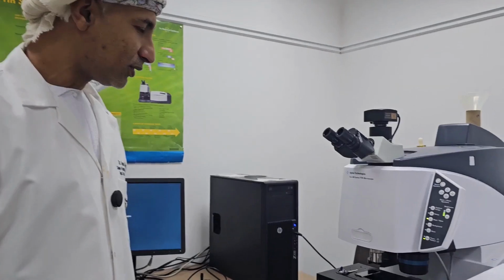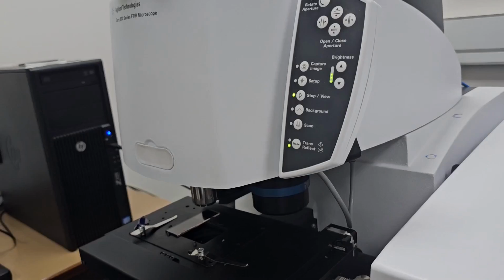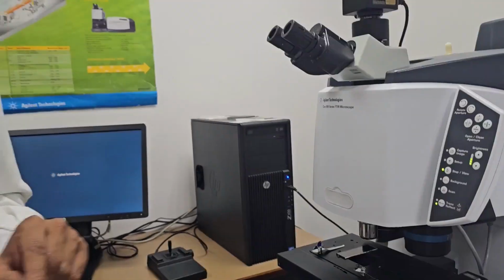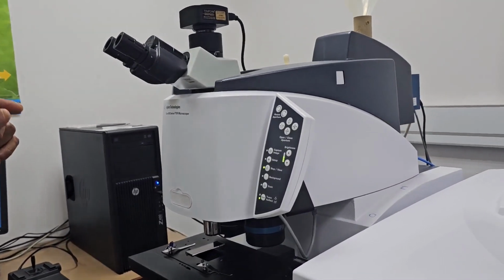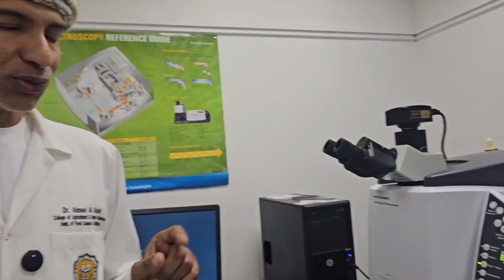In the FTIR microscope, we have different options. We can use reflection, transmission, and also micro ATR. In the reflection option, we normally use it when we have a small, defined location. In transmission, we use it when the concentration is small and we would like to have high intensity from the sample. ATR we use when the concentration or the point that we are looking at is extremely small. So we use ATR for that purpose.